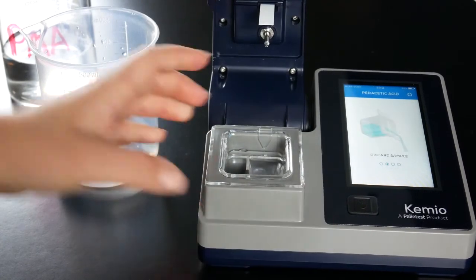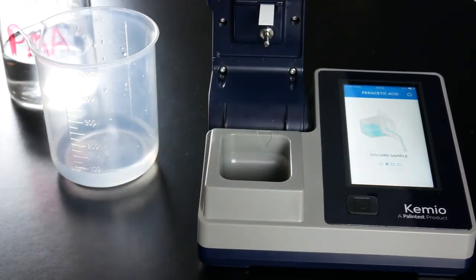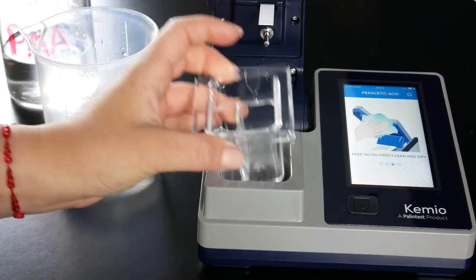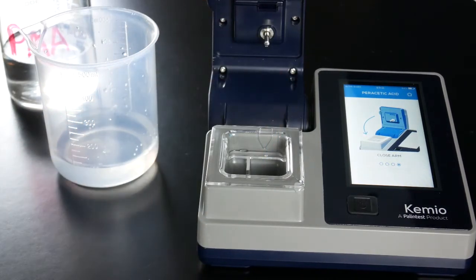After your test, don't forget to take good care of Kemio. Discard sample waste and toss any used sensors in the trash.